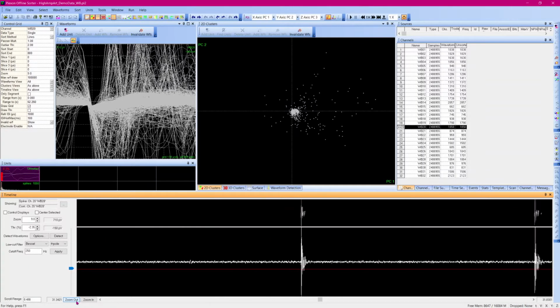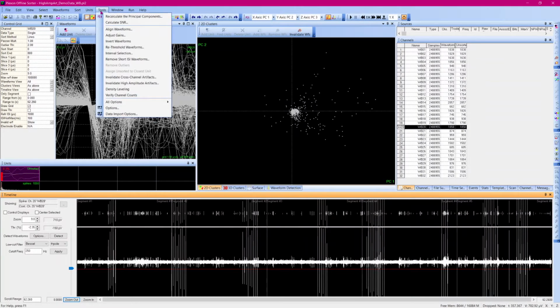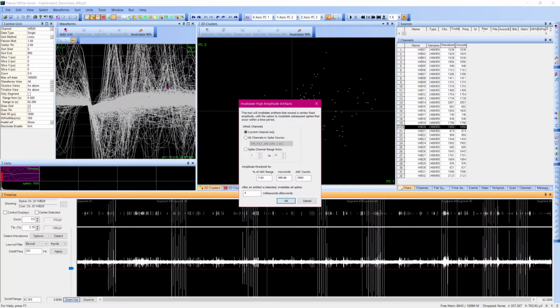Based on the characteristic of the artifact and these data, and its extremely high amplitude compared to the signal, the first tool I will apply is Invalidate High Amplitude Artifacts. I will select to apply this tool across all channels. The amplitude threshold is the minimum amplitude a signal must cross to qualify it as an artifact. Based on my exploration of these data, 1 millivolt is a conservative value, and 500 microvolts is a more aggressive removal. Once a signal crosses the 500 microvolt threshold, you can define how many milliseconds after will be also classified as an artifact. Any waveform that occurs within that period will be invalidated as an artifact.